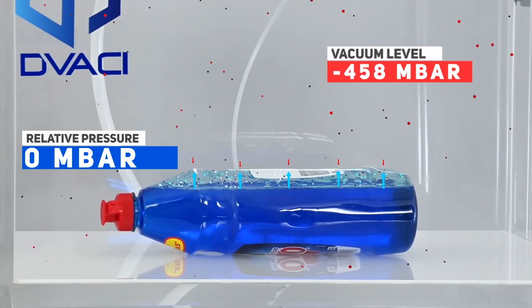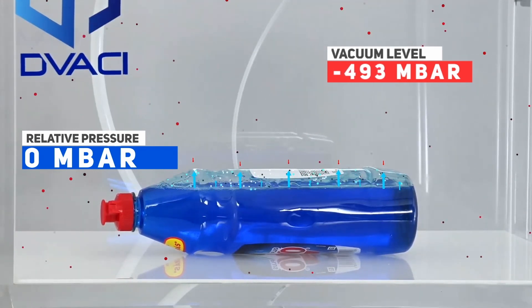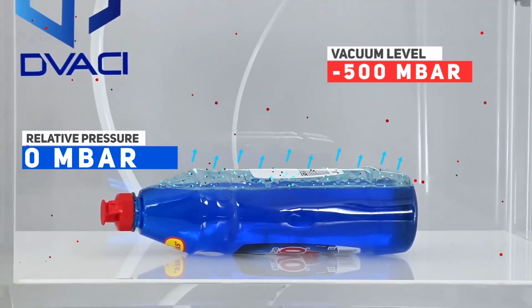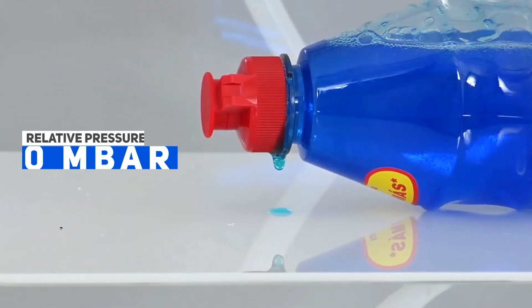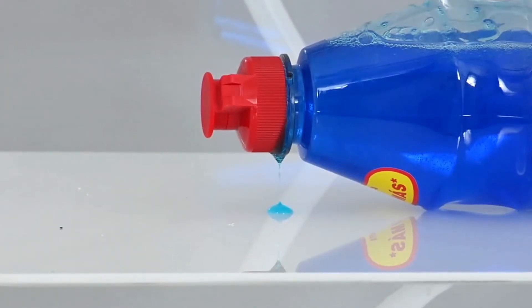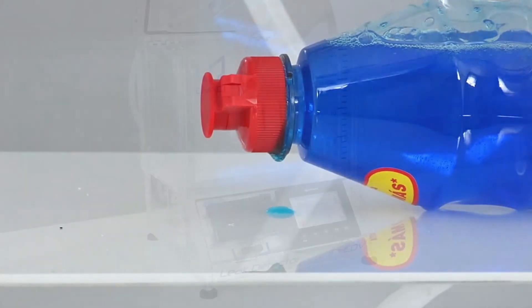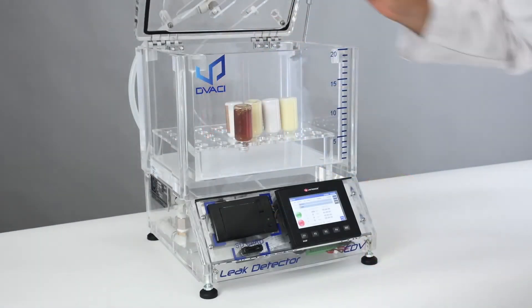If there is a hole, the internal pressure — now higher than the external pressure — will seek to balance itself out by expelling gas or liquid out of the packaging.